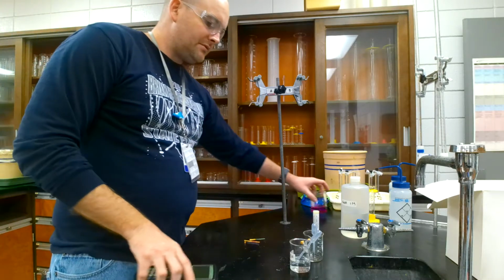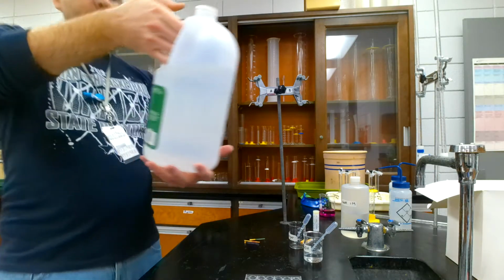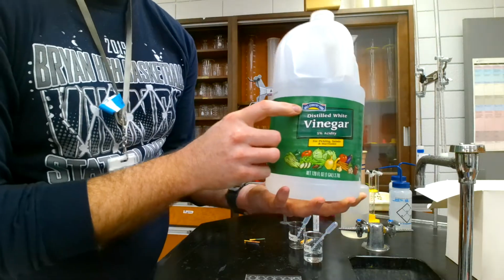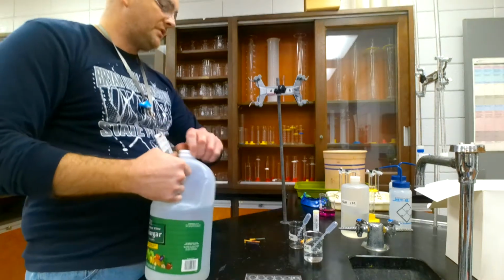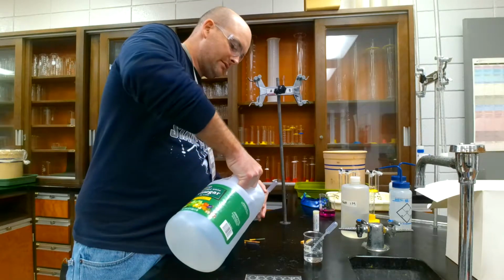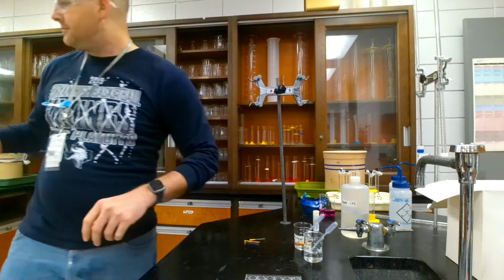And what you're going to do is take some vinegar, and you're going to note that the brand of it is the Hill Country Fair, and it is 5% acidity. Okay, that's important for your paper. And then here, I'm going to pour it into a beaker.